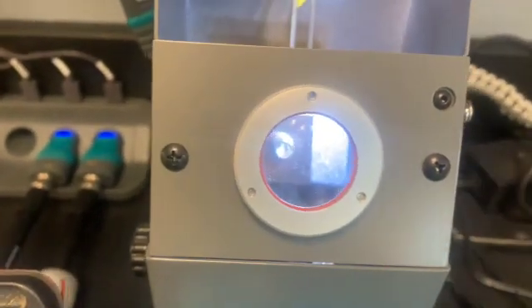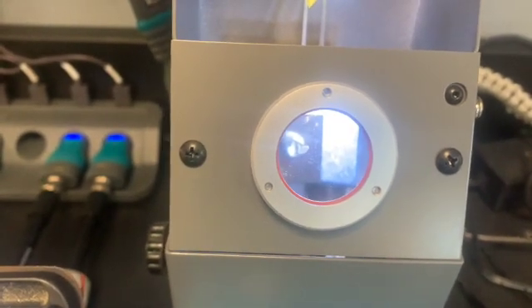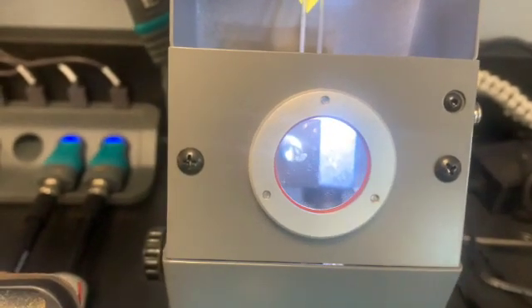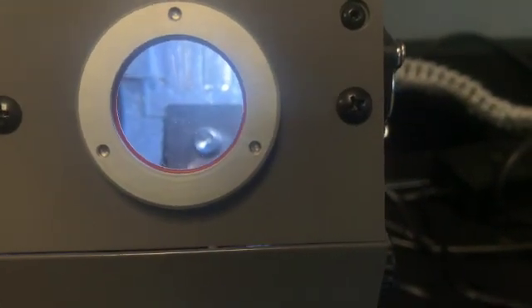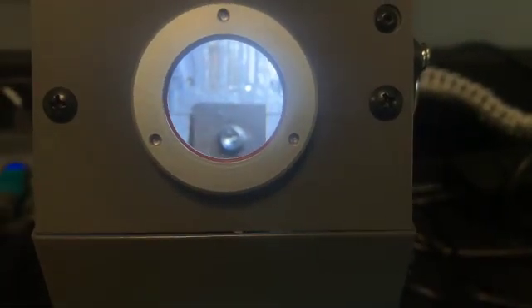So a tip, sometimes when you're working on this, you need to twirl the capillary tubes very carefully. They'll help you see if there's any changes with your substance. Okay, so just a friendly tip on how to work with the melting point step. Okay, so my temperature is about 161, and I'm going to see if I can show you what's going on here. I'm not sure you're going to be able to see it, but we'll give it a try. What we're looking at, and again, I don't know how well it's showing up on the camera, but I'm beginning to see a change on my first capillary tube.